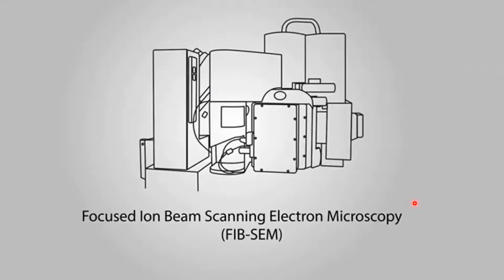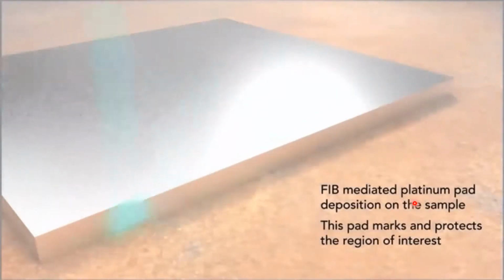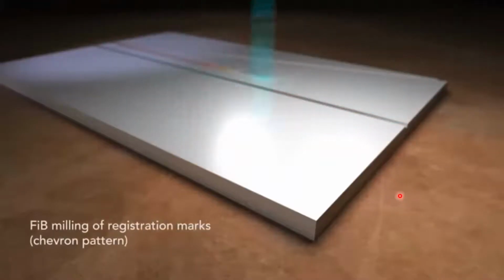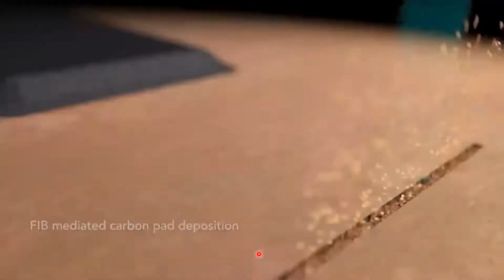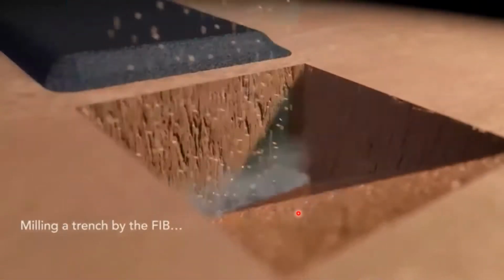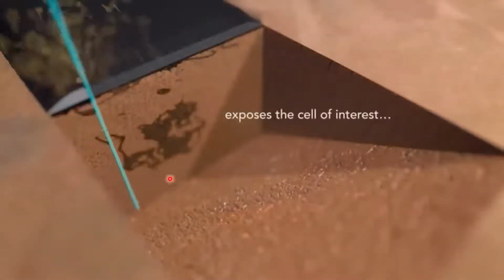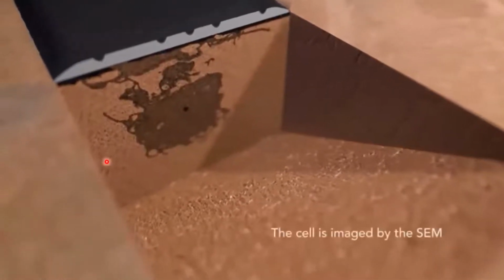So now I'm trying to bundle everything together in this very nice animation from a couple of friends at the NIH. Again, we are depositing a pad of platinum on top of our block face. We are milling in those trenches here with a focused ion beam. We put some carbon on top, and this is really important for the contrast that we're eventually seeing. And only then we start to trench into our sample. This can be done very fast, or we can do it in a polishing step with a focused ion beam to have a very smooth surface of our cross section, and that's in that case a single cell.